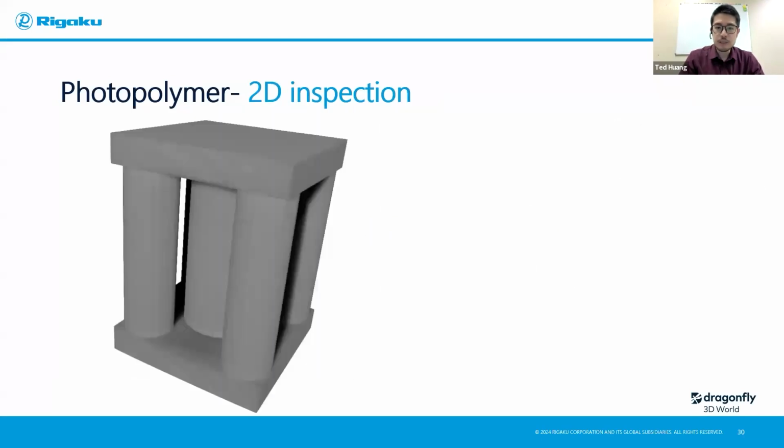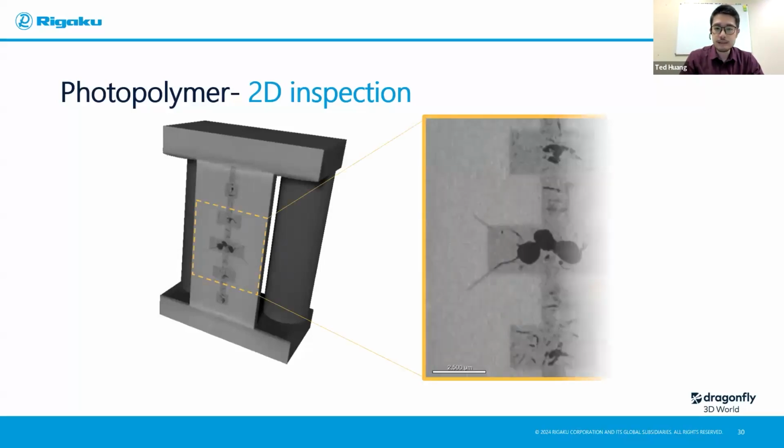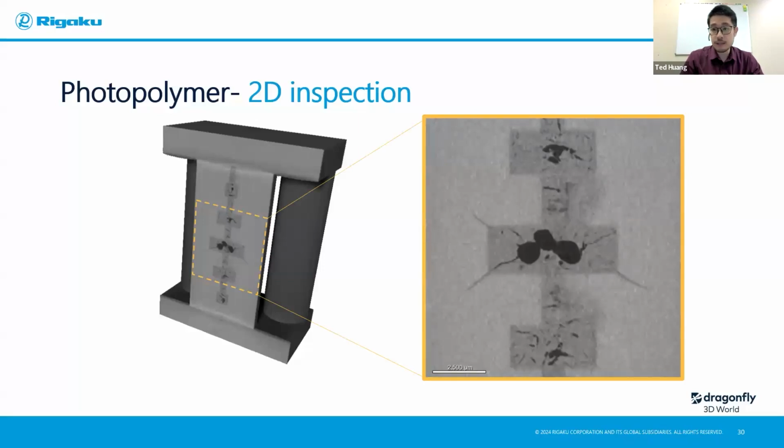So with that scan, even just 2D inspection is also going to give us a lot. Because we have 3D data, we can just slice it open at any place and use it as a 2D image. So let's look at the center here. Because I know the printing process, the vat polymerization, I can tell immediately from the different contrast of the different phases inside from X-ray, okay, these are definitely the wax that was used as a support for the internal structure, but they weren't leaked out properly. So after solidification, they shrink because they have a different thermal expansion coefficient compared to the actual printed product. They shrink with the stress.